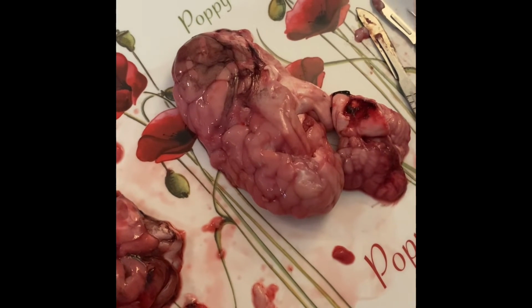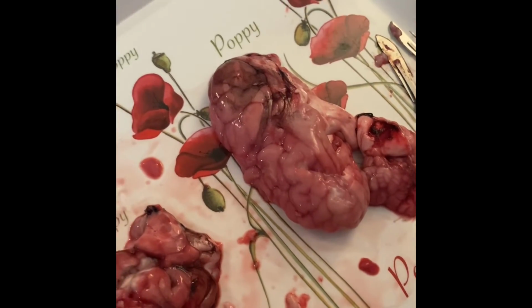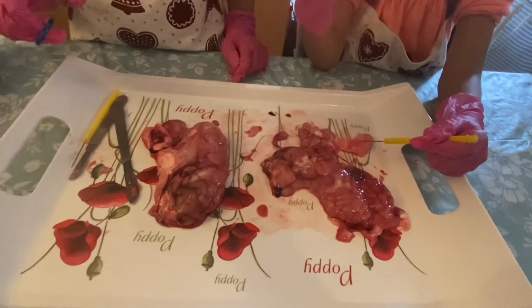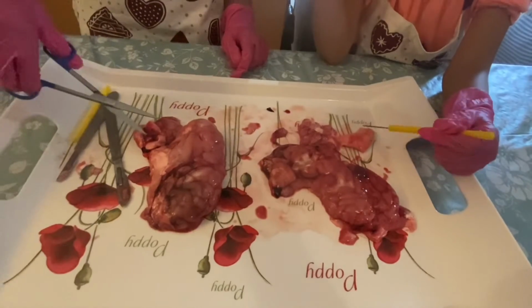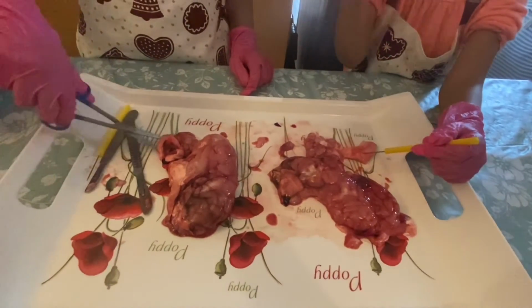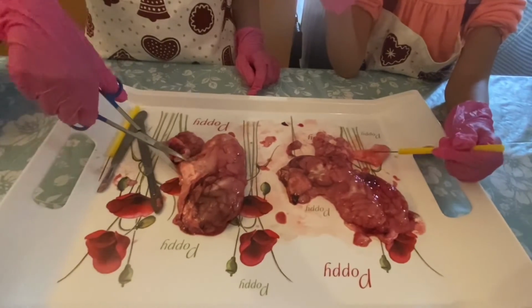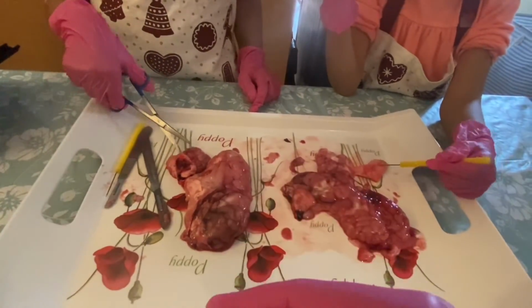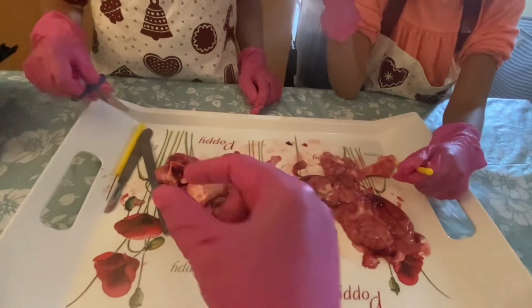And what are the halves called? Hemispheres. Okay, wait. Scraping off. See in the middle of this blob. Look. See. This is my part of the cerebellum. The cerebrum. The cerebellum. The wrinkly part is the cerebrum. That flower-shaped bubbly thing, that's the cerebellum.